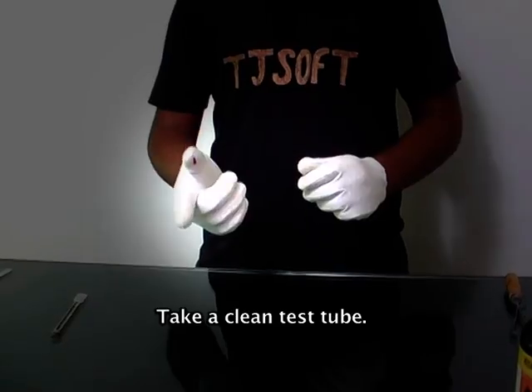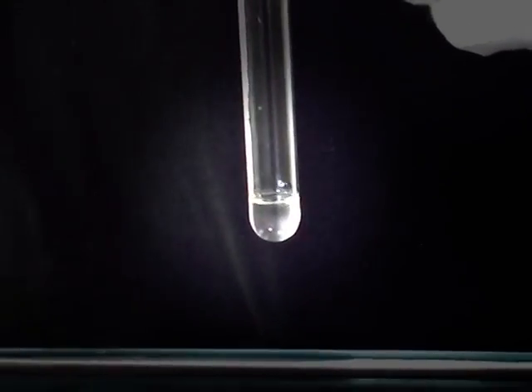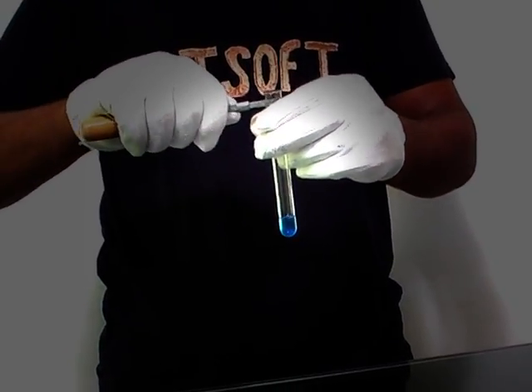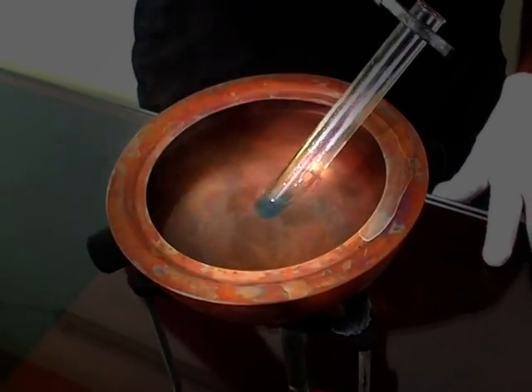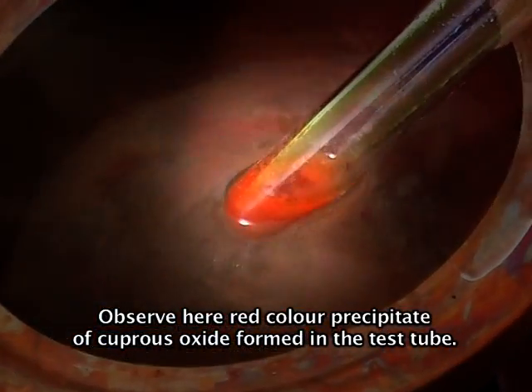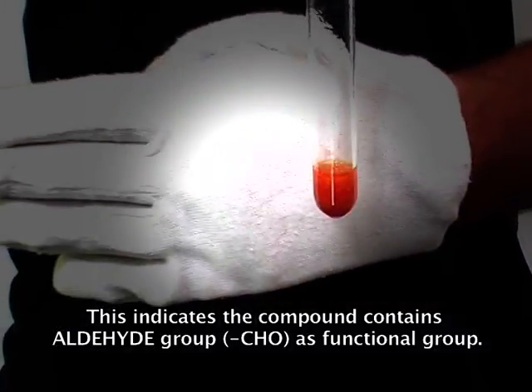To confirm it again, take a clean test tube. With the help of a pipette, add 1 ml of acetaldehyde. Now add a few drops of Fehling's solution to it. Hold the test tube with a holder and place it in a hot water bath. Observe here a red color precipitate of cuprous oxide formed in the test tube. This indicates the compound contains an aldehyde group as the functional group.